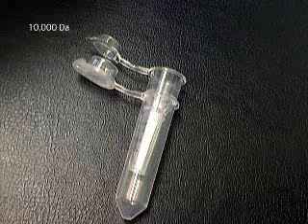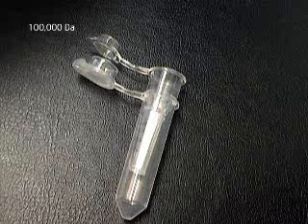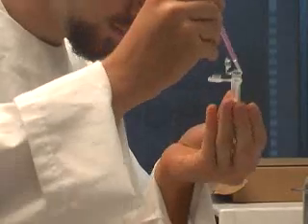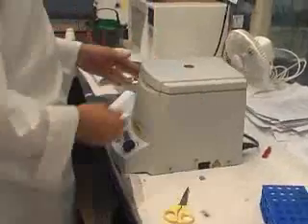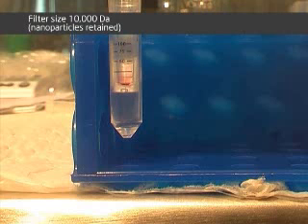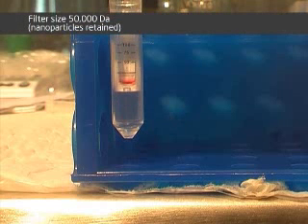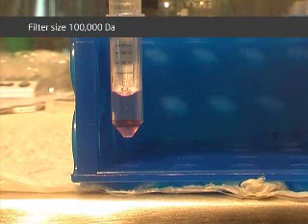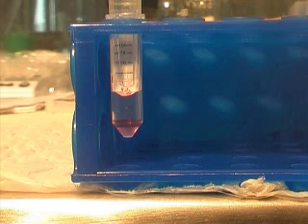Three sizes are used: 10,000, 50,000, and 100,000 daltons. A sample of the gold nanoparticles is placed into each tube. The tubes are centrifuged to allow particles to fall onto the membrane. These results indicate that the nanoparticles are between 50,000 and 100,000 daltons in size.